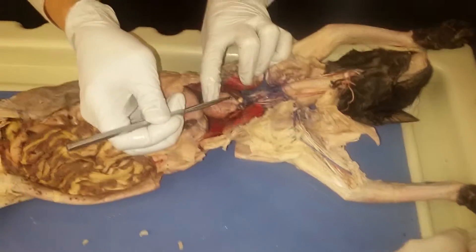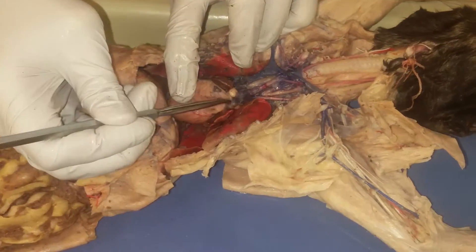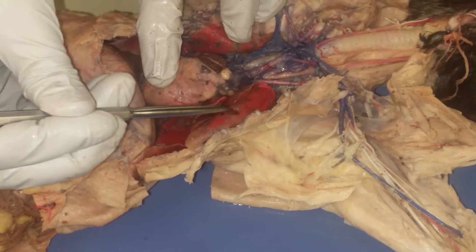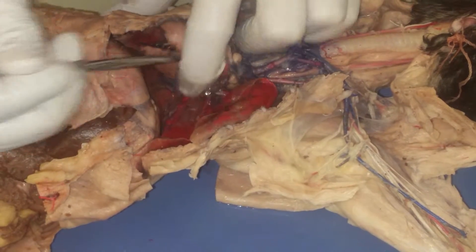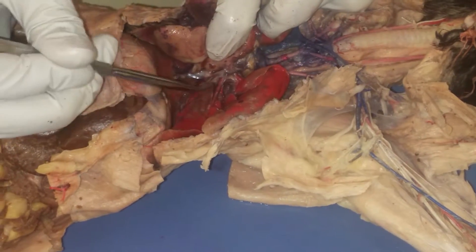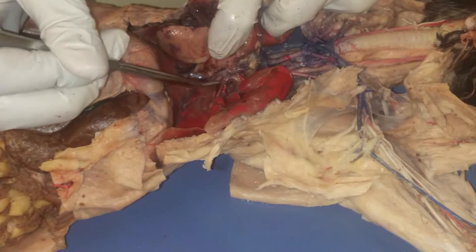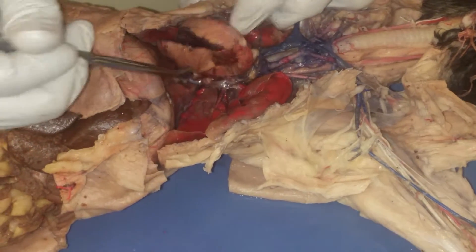Here is your pulmonary trunk. It leads to the pulmonary artery, which brings deoxygenated blood to your lungs. These bright red ones that you see leaving the lungs are the pulmonary veins, bringing blood back to the heart.